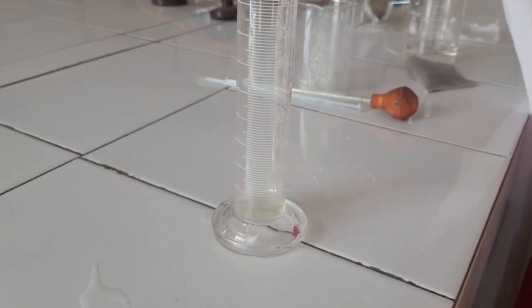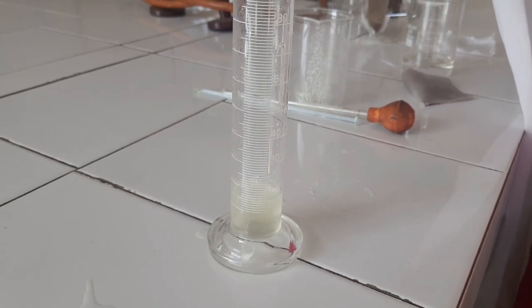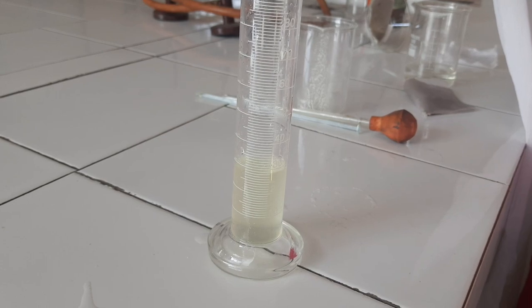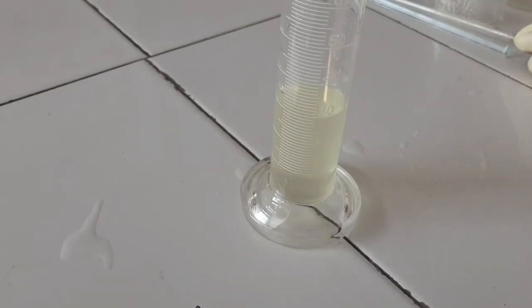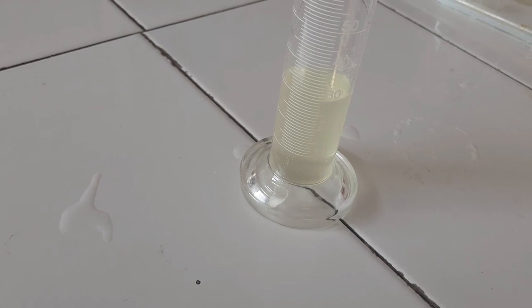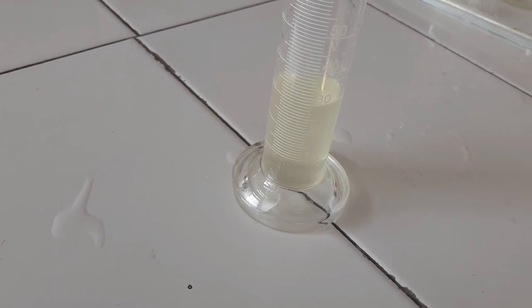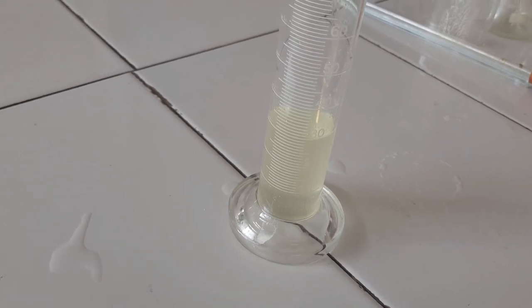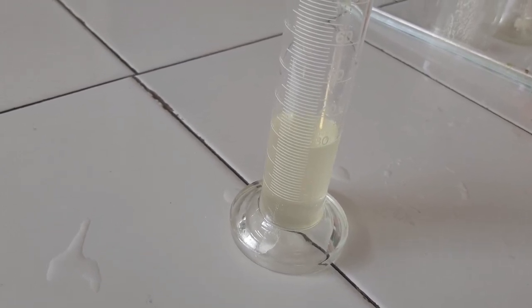Transfer it into measuring cylinder and make up the volume to 30 ml with water. Then transfer it into final container stored in cool place away from light. It is used as a pharmaceutical aid and carminative.